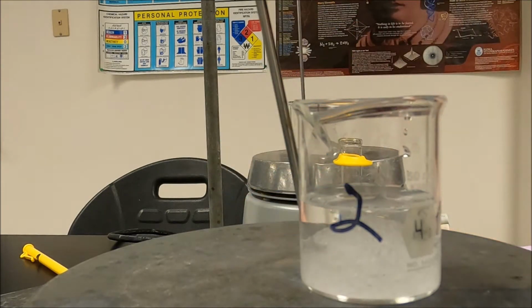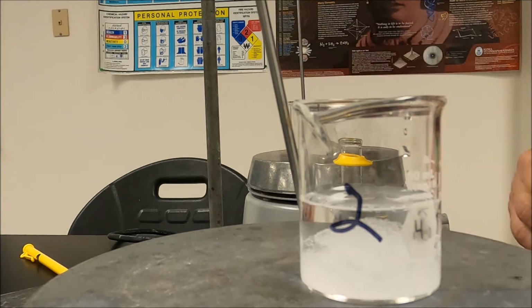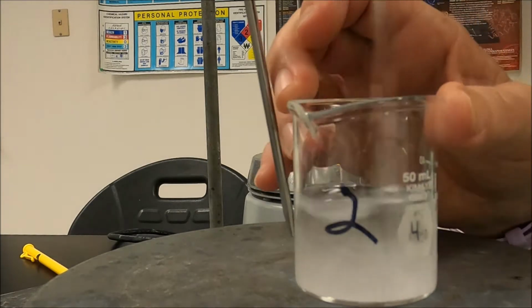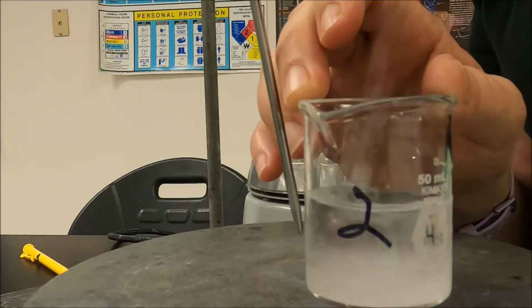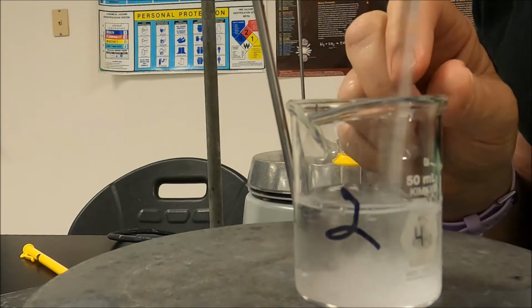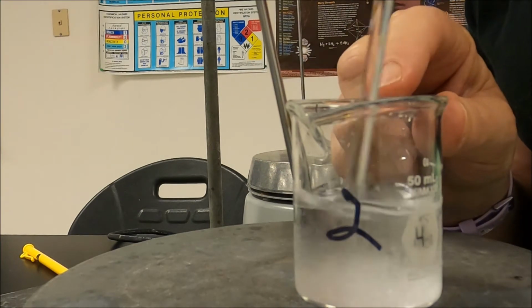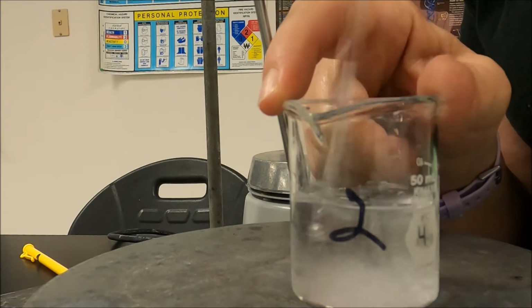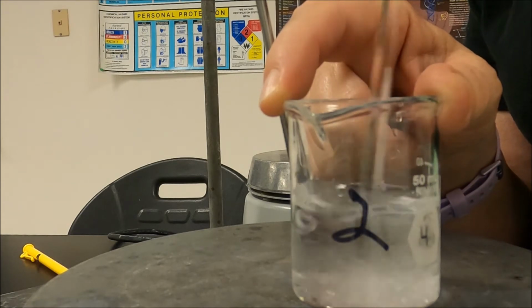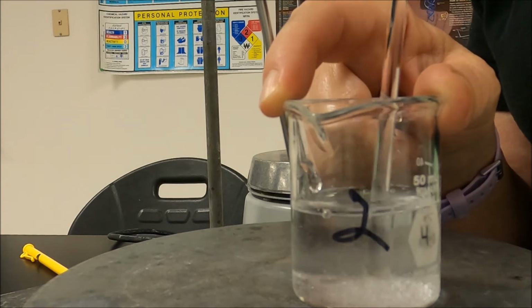Now, before we start heating, we need to make sure that all of our solids are dissolved. So I'm going to get a stir rod and we're going to mix stuff up. Since we're doing a boiling point elevation, we want to make sure the solution is made before we start the experiment. Okay, it's dissolving rather quickly. Nitrate compounds usually do dissolve very quickly.